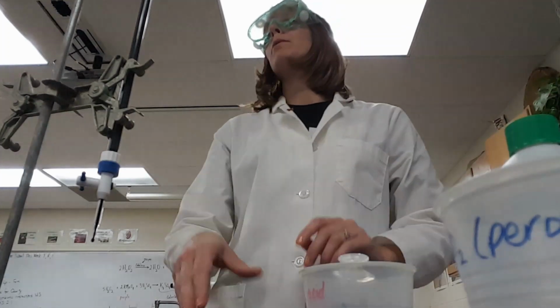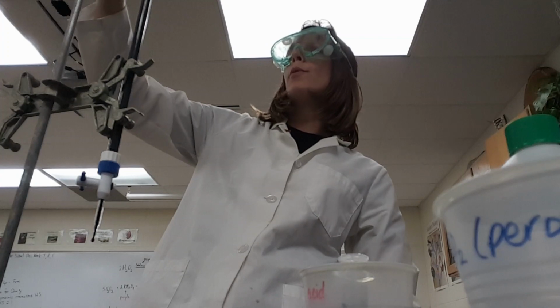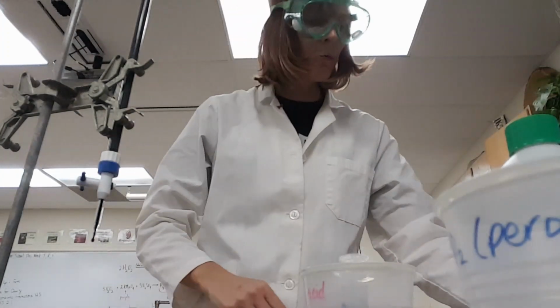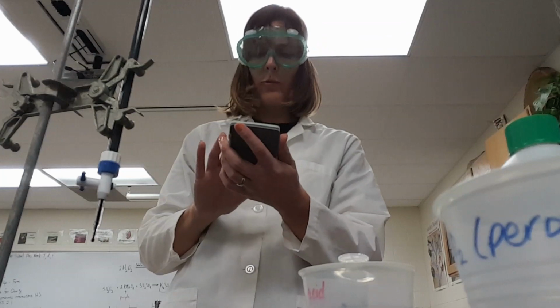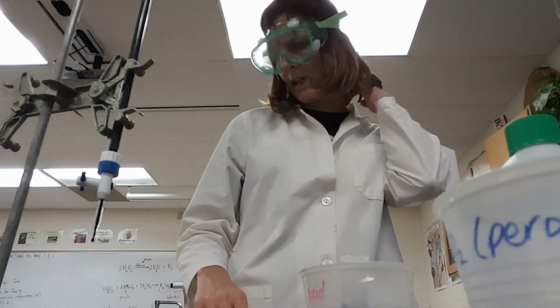All right, got to make a reading here. I am at 15.3. All right, so 15.3 minus, we had 11.6, used 3.7. That is weird. I used pretty much that time, so I don't know.